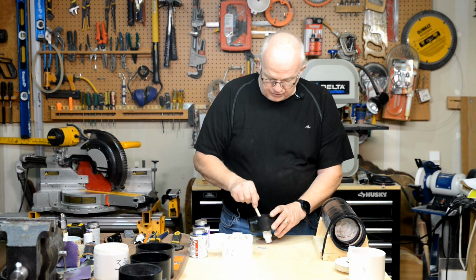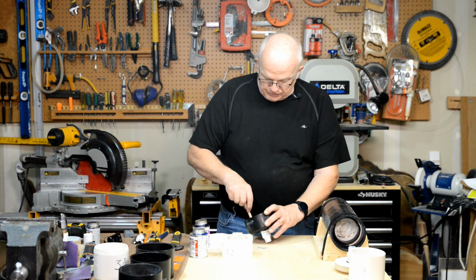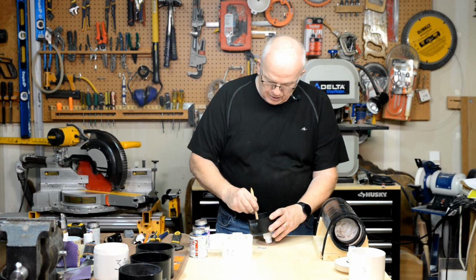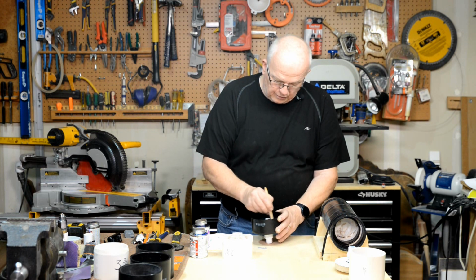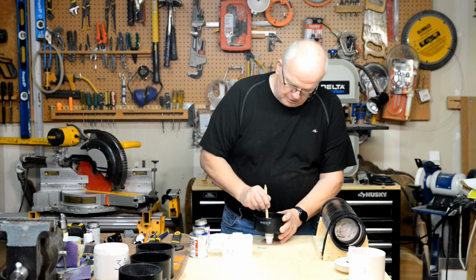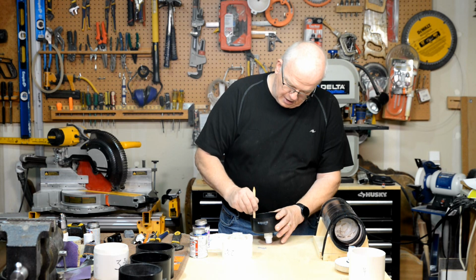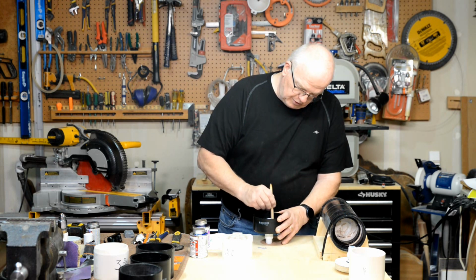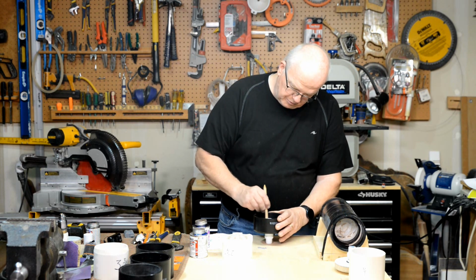Okay, as you're mixing it, you want to move it all the way around the system here. I'm going to have to turn this over, and I got a point on that end. Okay, I got a good mix going on here. I'm going to push it all the way around. Push it up against the edge of that PVC, so that it wants to seal properly against that PVC.